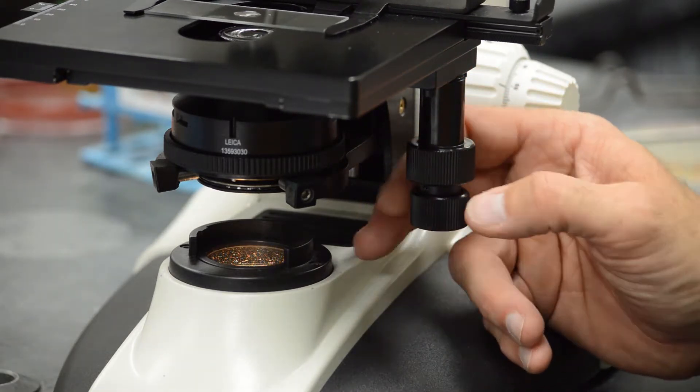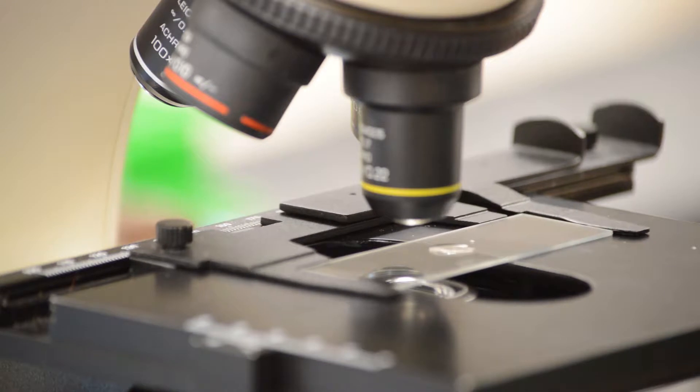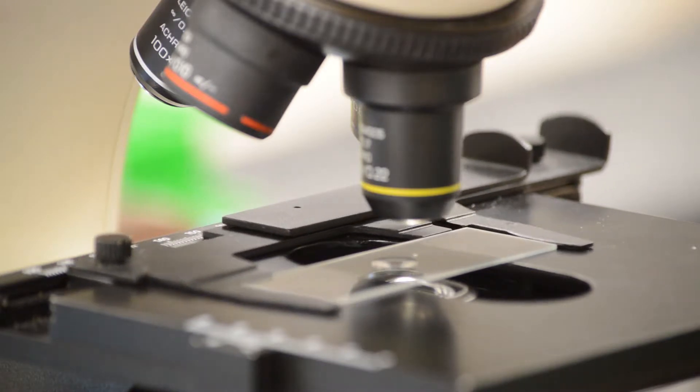If you take the knobs and you move them you will see that the stage moves right to left and the other knob will move it back and forth.